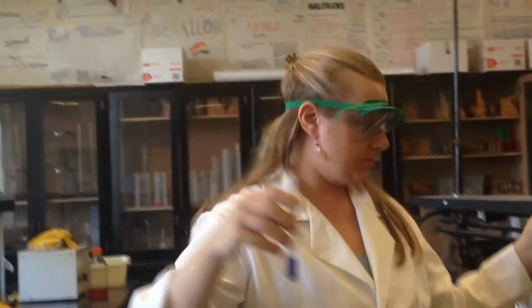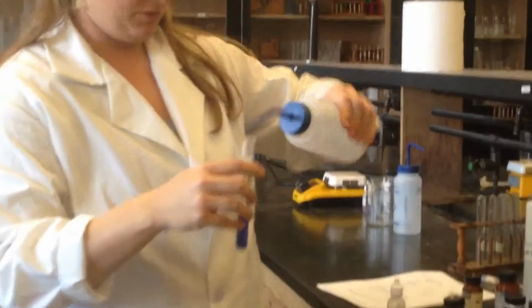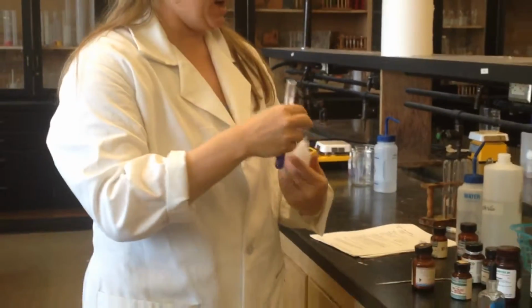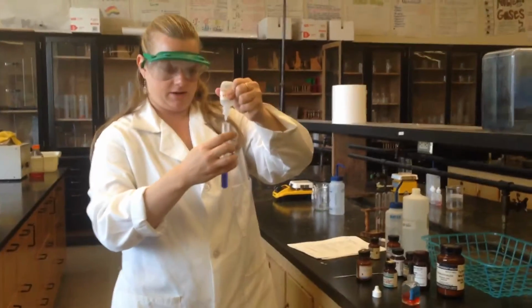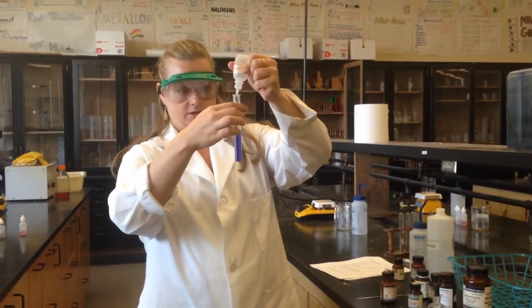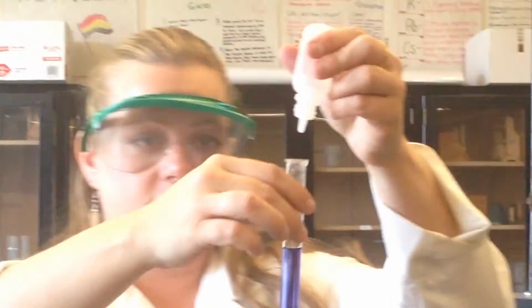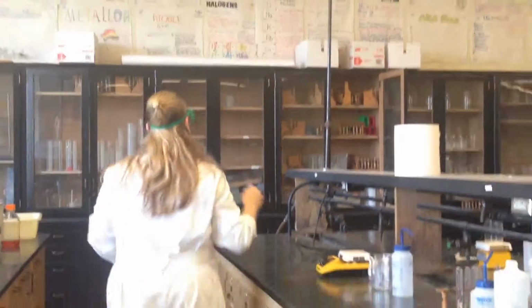Okay? And then if we added more water... Looks like Kool-Aid. Let's see, I'm running out of acid, but let's see if we could change it back. We might be able to change it back. Oh, sometimes it will. Oh, it's starting to get lighter. So is it still blue or is it starting to turn? Ooh, let me get a little bit more acid.